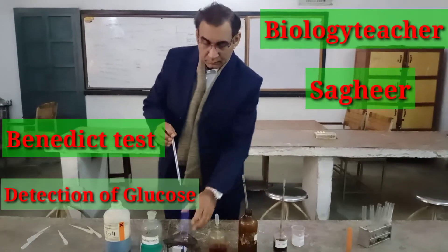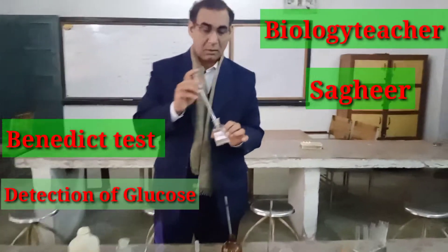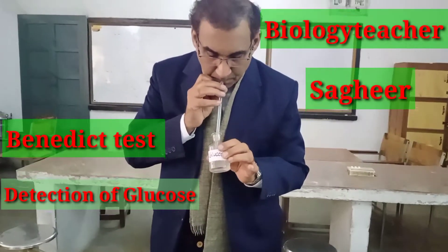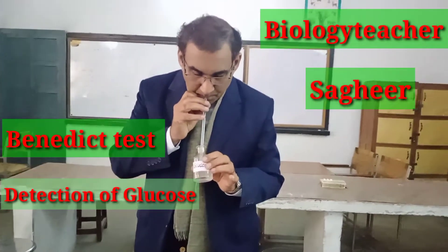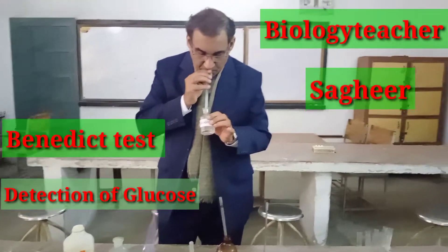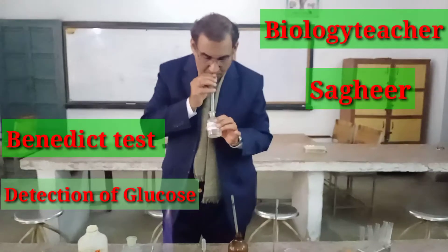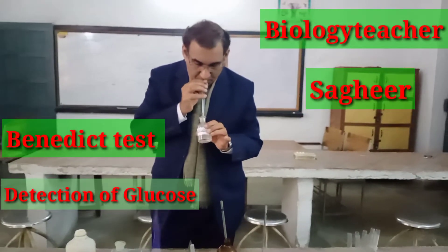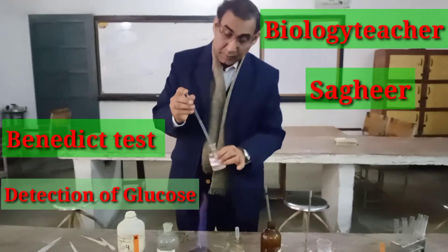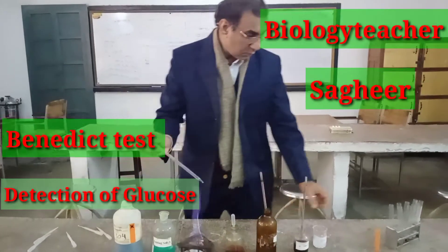Here is the glucose solution. I am checking glucose.